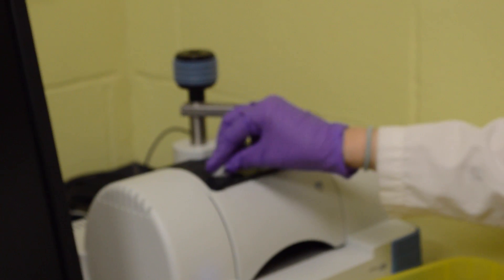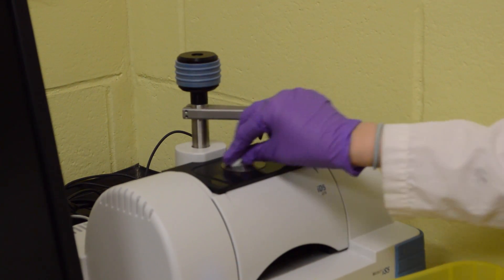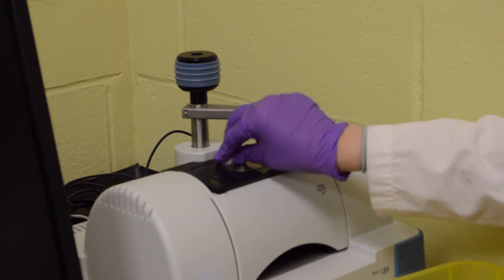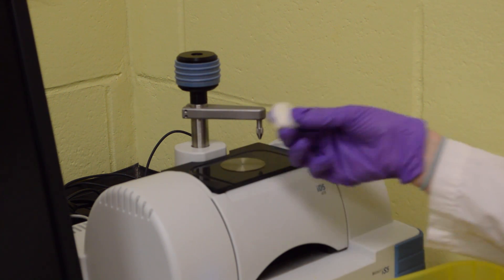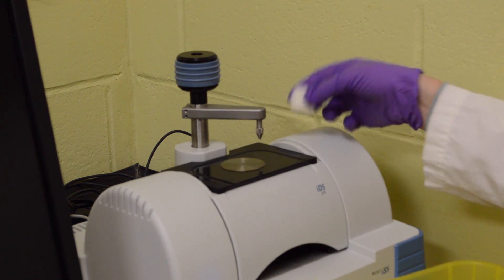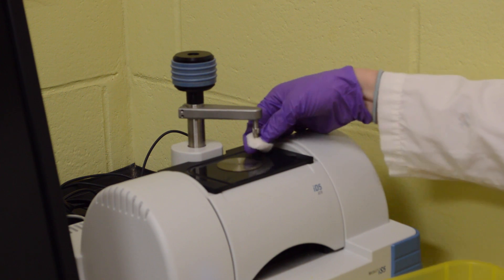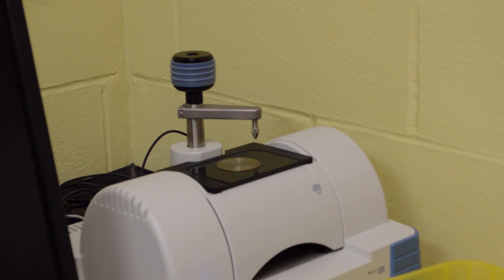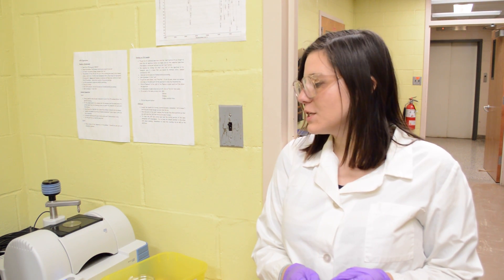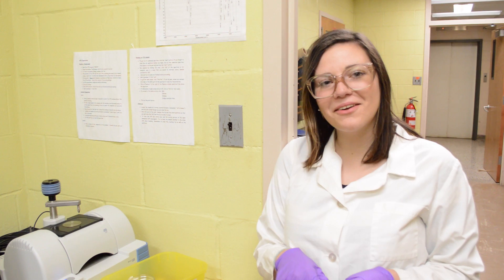We'll start by wiping this region, the plate and the crystal. You want to wipe it down really well with isopropanol. Then you can also use the same cotton swab to clean the top part. Make sure that you thoroughly scrub this. Then you can wait until it's dry just to make sure that there's no more sample on there that you can't see. I think it looks pretty good. So that is how you use an ATR.